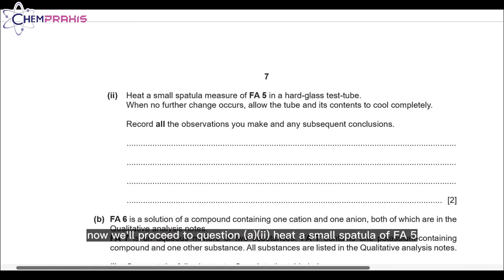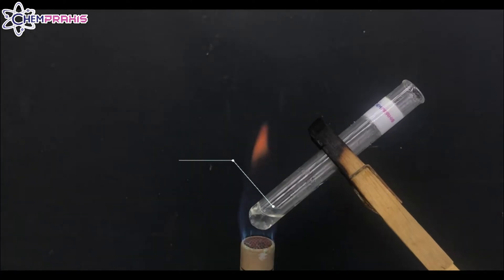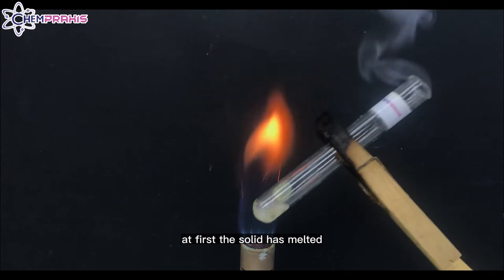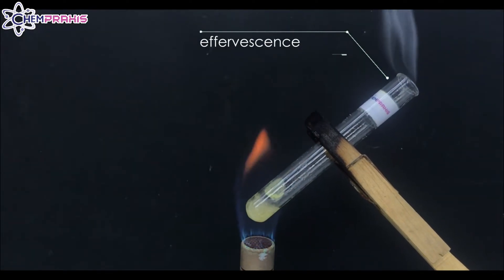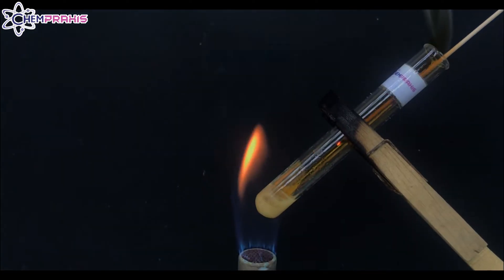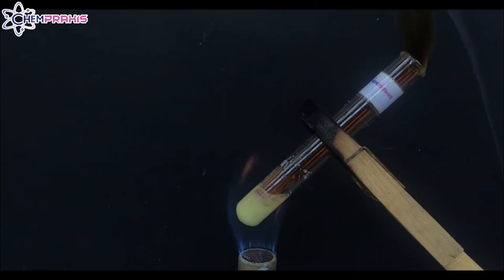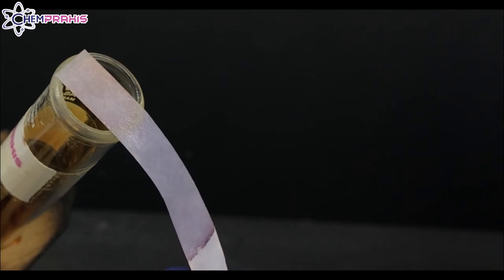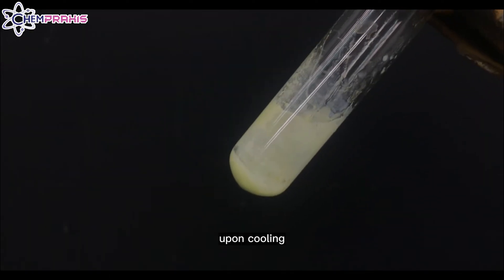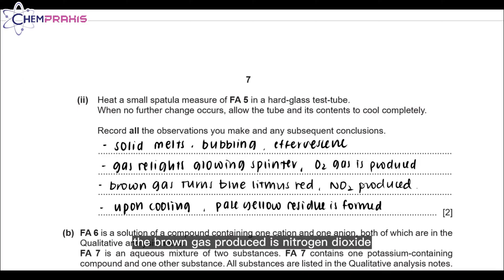Now we'll proceed to question A2. Heat a small spatula of FA5 in a hard glass test tube. When no further changes occur, allow the test tube and its contents to cool completely and record all observations. At first, the solid melts and some bubbling is observed. Effervescence is also released. After a few minutes of heating, some brown gas is produced. The oxygen gas produced relights the glowing splint. The nitrogen dioxide gas released turns the blue litmus paper red. After cooling, there will be some pale yellow residue left in the test tube. The brown gas produced is nitrogen dioxide.